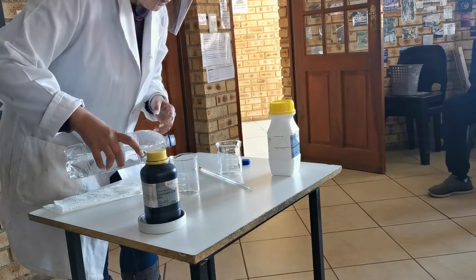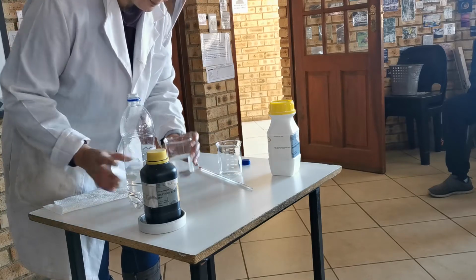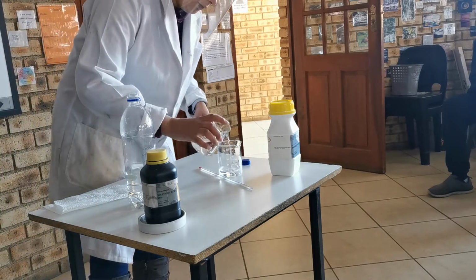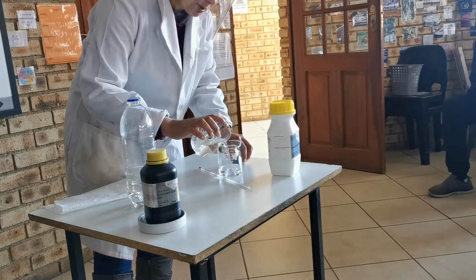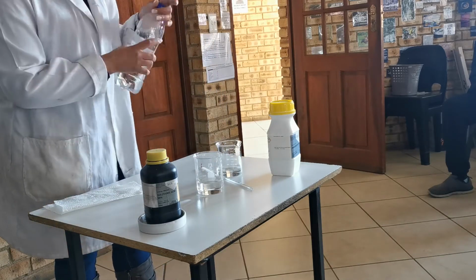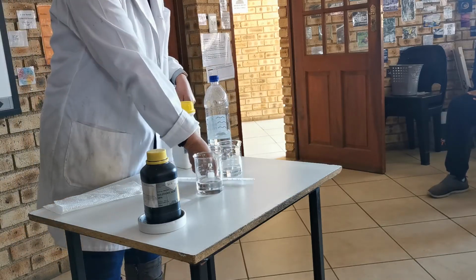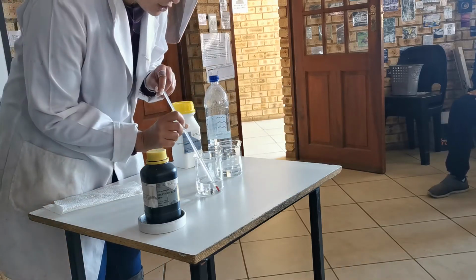Now, what we're expecting to see is a temperature spike for our solution of acid that we're going to create. By temperature spike, I mean we're expecting the temperature to increase quite dramatically.